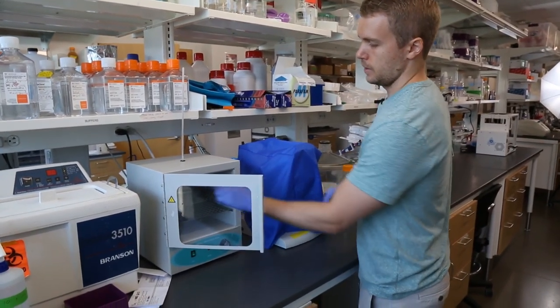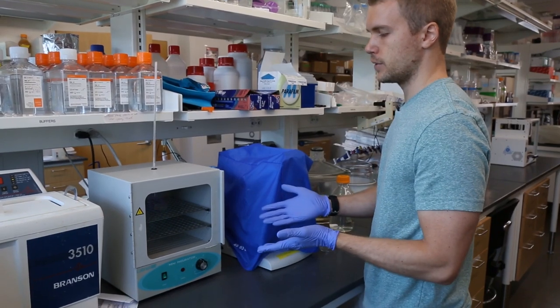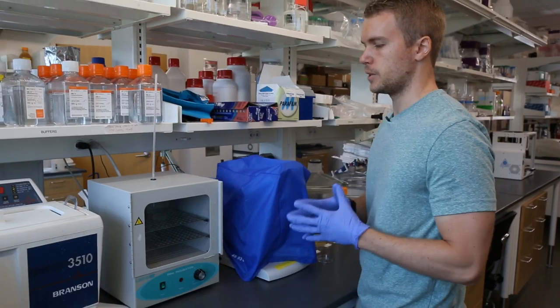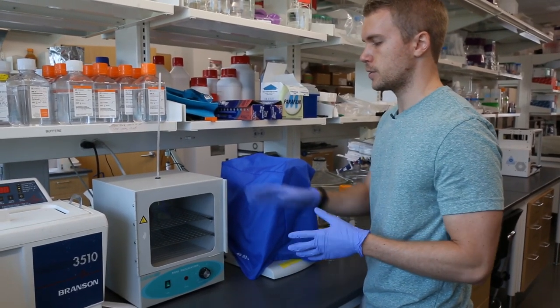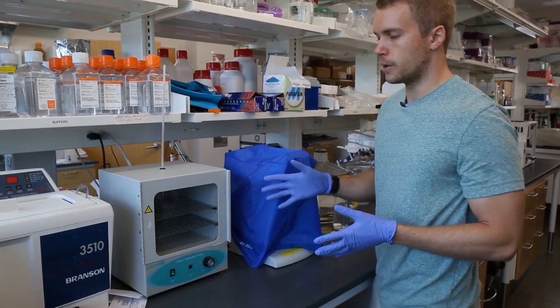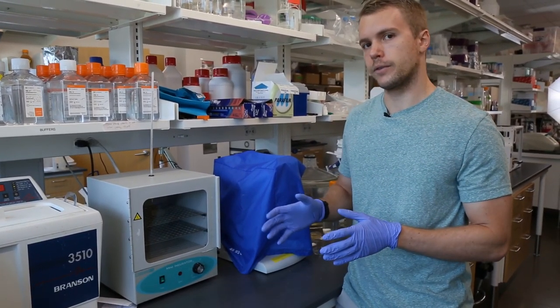Now the print's done, all I have to do is put the life support and my print inside of a 37°C oven. If you're doing this with cells, it's obviously just going to be a cell incubator, but in this lab space we don't have to worry about anything being sterile, so I can just put it in a regular 37°C oven. I do recommend for an ink like collagen that you release it between 37 and 45 degrees Celsius.